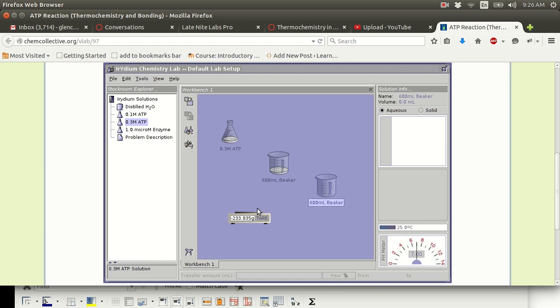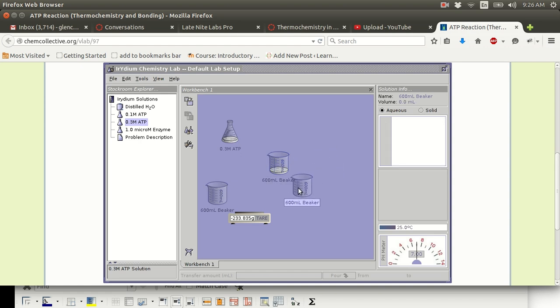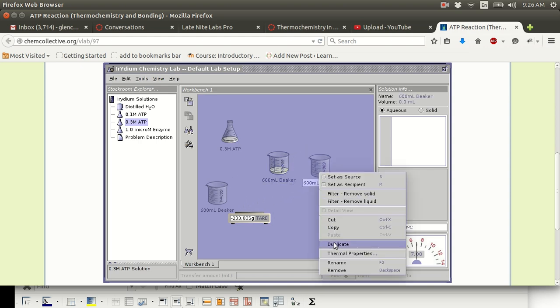Now, the reason why this is a little weird is because you cannot do the same thing with other beakers. To make this simple, each empty beaker in this lab, strangely enough, weighs a different amount. Look, this empty beaker, it is not 0. It should have been 0 because the balance was tared to think that this empty beaker was 0. And look at this. There's yet another number here.